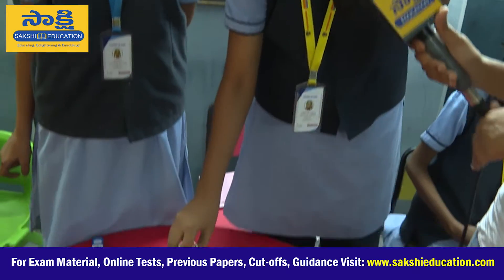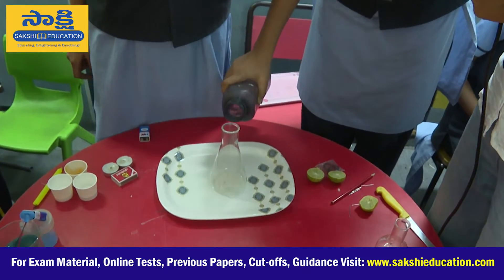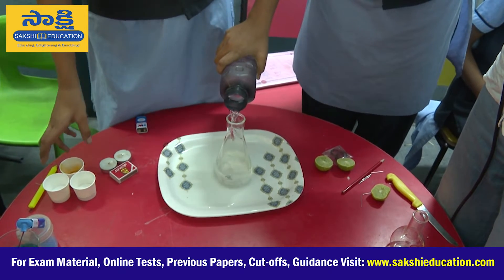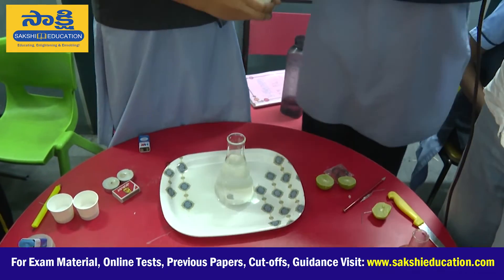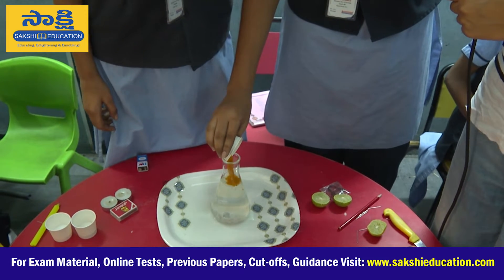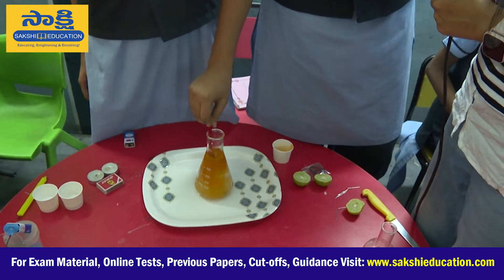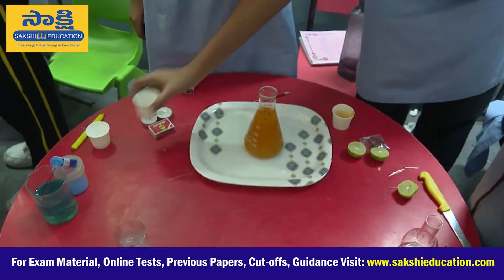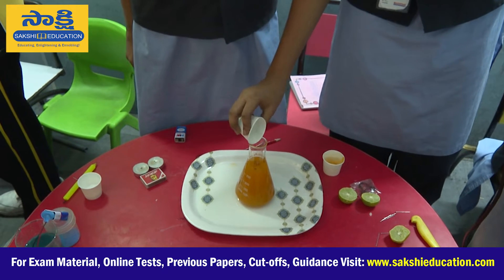Today we wanted to do an experiment with science. Take a beaker and fill the beaker with water. After filling the beaker with water, add a few amounts of turmeric. Then the colour changes to an orange-like substance. After that, add few grams of detergent.